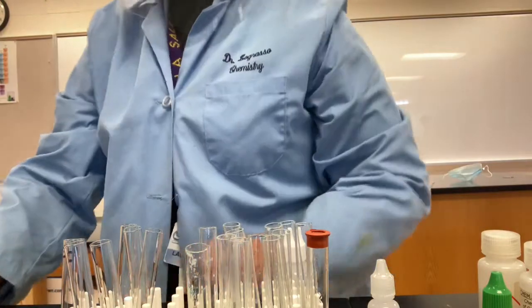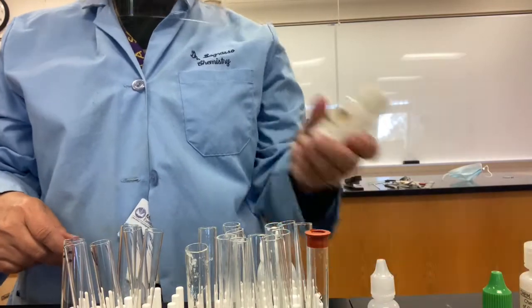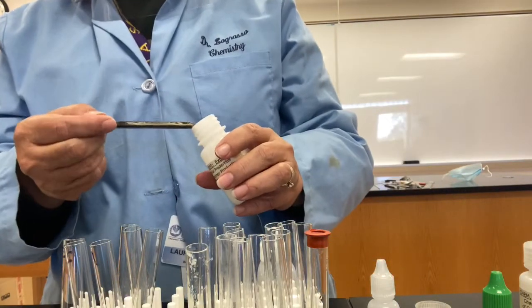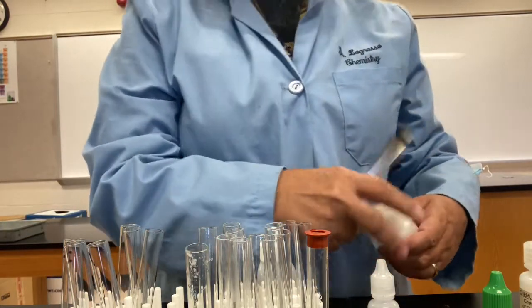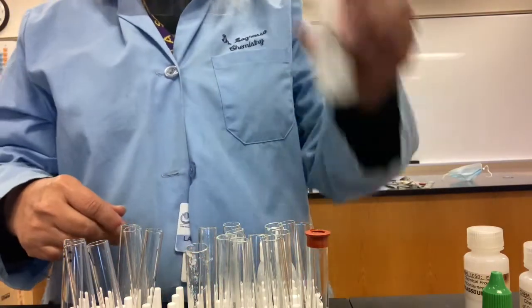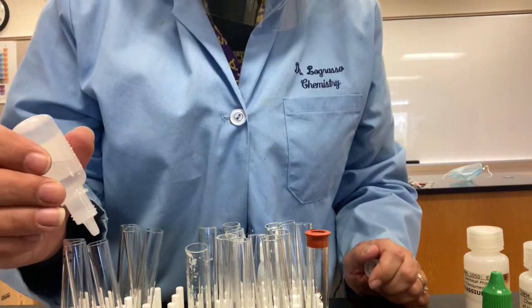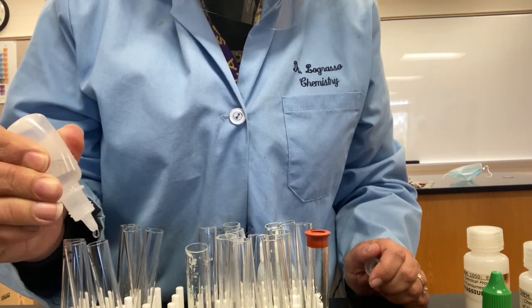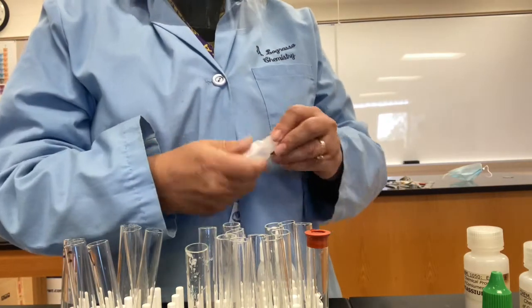So let's start. We have to add in some potassium iodide. That's going to be the source of our iodine. So here's potassium iodide. And we'll put a small amount into a test tube, just like we've been doing. And then it says to add some deionized water again. So here's some deionized water, and we're going to put in 1 milliliter, pretty much like we've been doing. So 1, 2, 3. So 20 drops, that's our 1 milliliter.